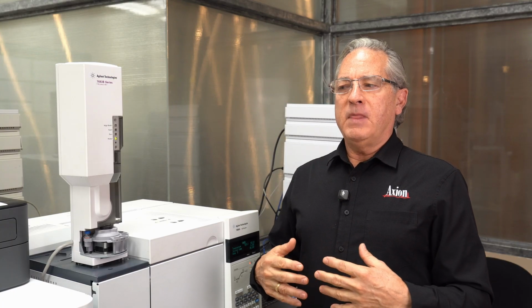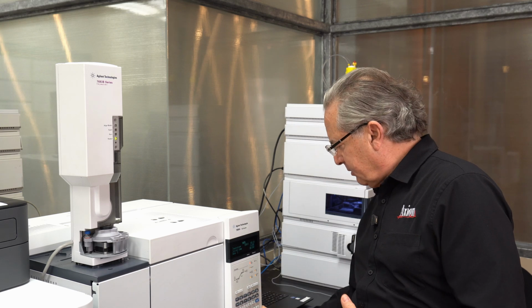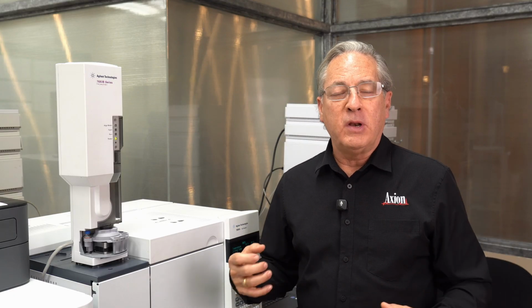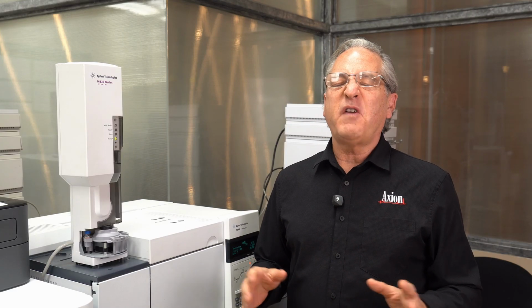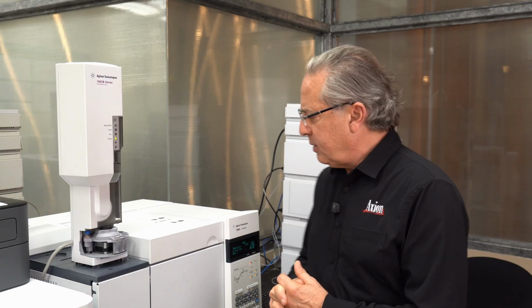The whole trick here is we don't want the column hot with no flow. So fortunately, I'll take my column temperature down to 40 degrees, so the column itself is not very hot, and when it loses flow, when I pop open the liner, there's going to be no flow going through the column, and if I do it fairly quickly, I'm not going to do much damage. I wouldn't do this and then walk away and take a coffee break and come back half an hour later, because you don't want the column to ever be heated with no flow, but we're going to do it hopefully quickly enough that it's not going to make a big difference.